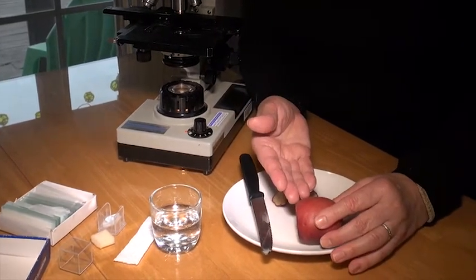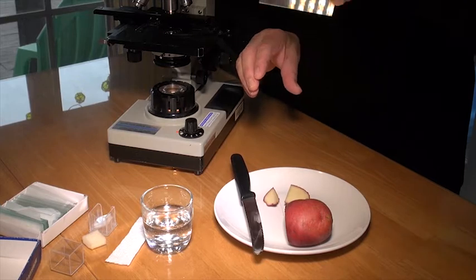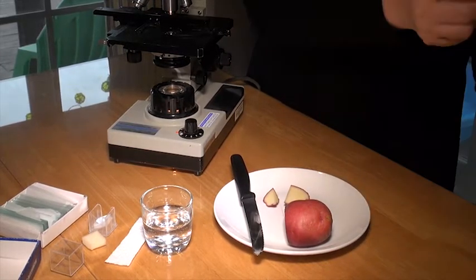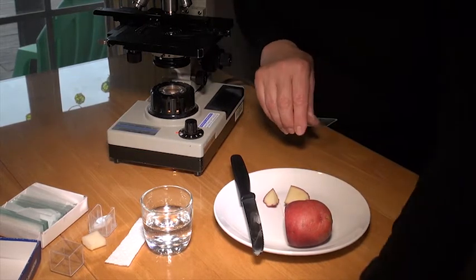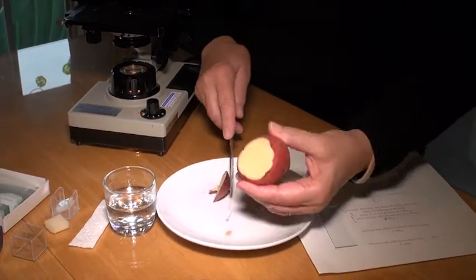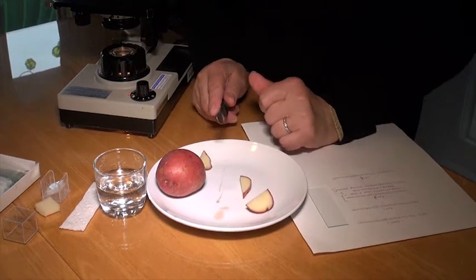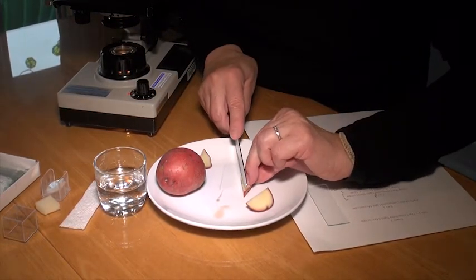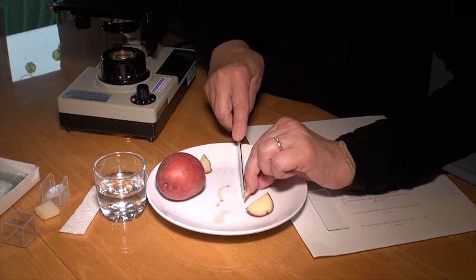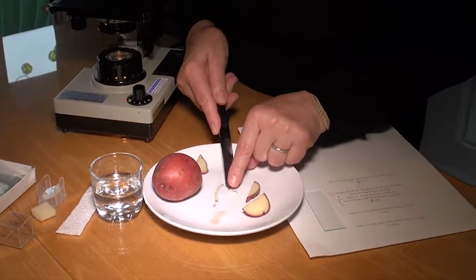And this is a red potato. Take a slide that's nice and clean, hold it from the edges, and check it. This one is a bit dirty, so I'm going to clean it. In class you wouldn't be given a whole potato — you'd just be handed a little chunk. What you'll do is take the thinnest possible piece. We don't want any home fries. I don't have any scalpels here, but that's not bad — okay, that's good.